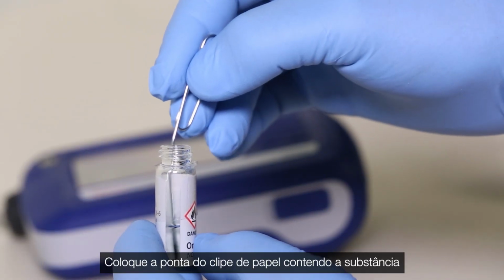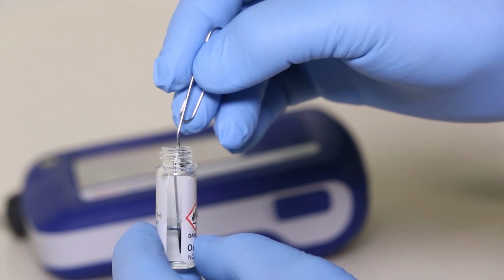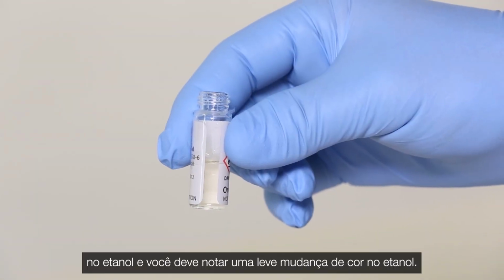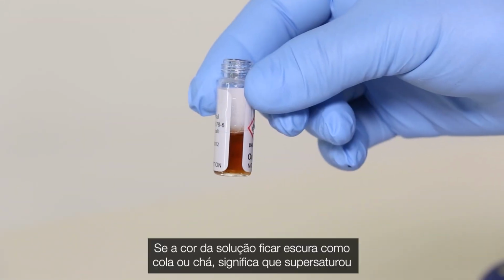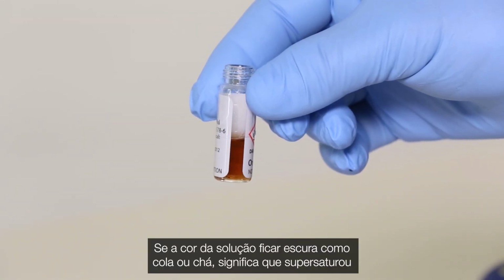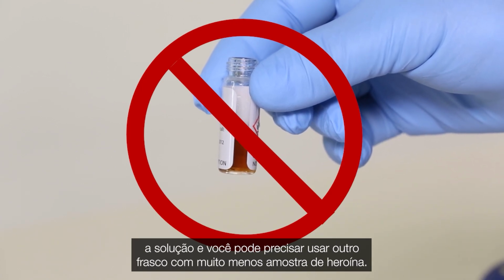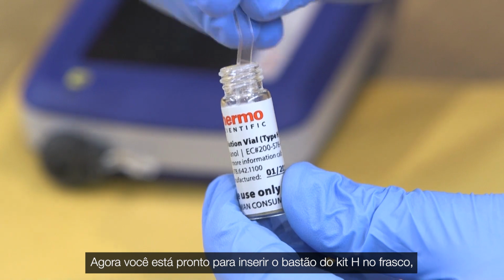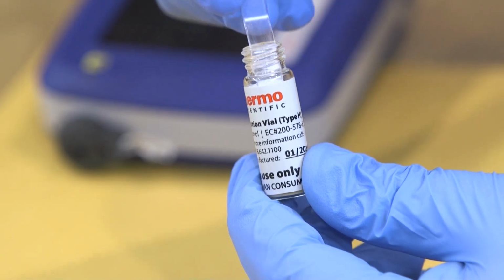Place the end of the paperclip containing the substance into the ethanol vial and stir for 1 to 2 minutes. The substance should dissolve into the ethanol, and you should notice a slight color change to the ethanol. If the color of the solution turns dark like cola or tea, you have oversaturated the solution and may need to use another vial with much less heroin sample. You are now ready to insert the H-kit stick into the vial as we demonstrated previously.